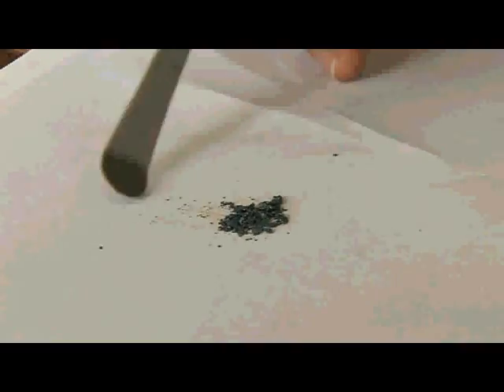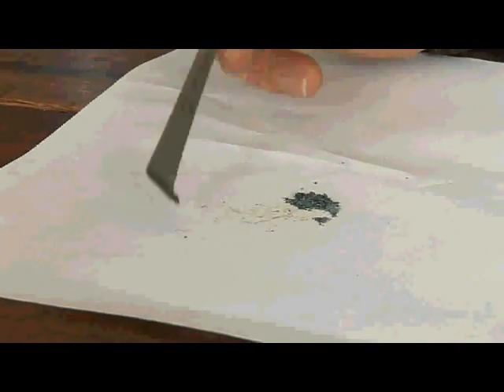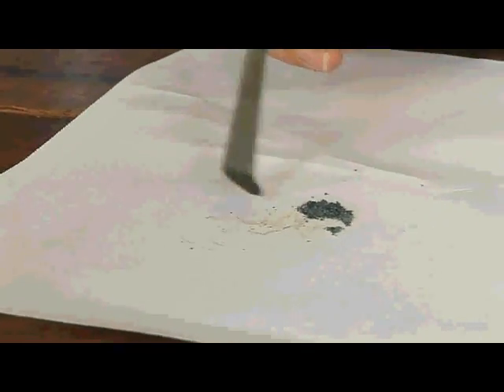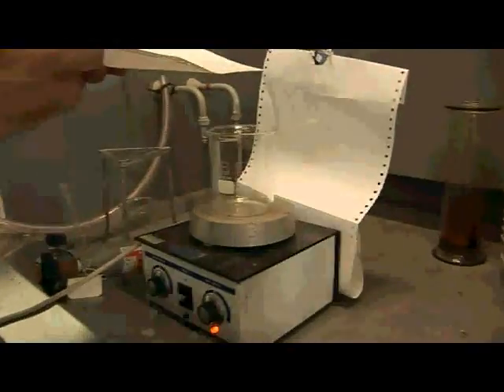Iodine has lots and lots of different applications. It's used for purification of water — if you've got water with a waterborne problem, like perhaps some bacteria, just a couple of crystals of iodine really neutralises them and makes the water much safer. But you can see that it's starting to leave some stains on the paper, and this is simply because we're iodinating the paper itself. So it's quite volatile, and what we're going to do is take the iodine across and put it into this beaker and warm it up slightly from below.